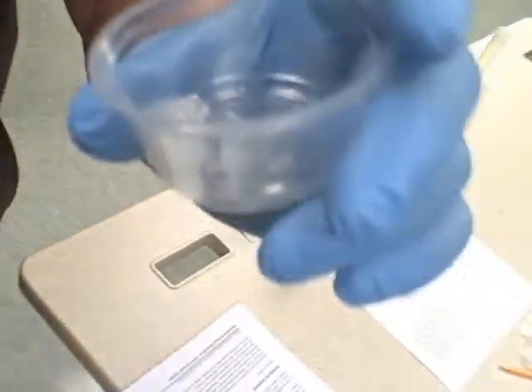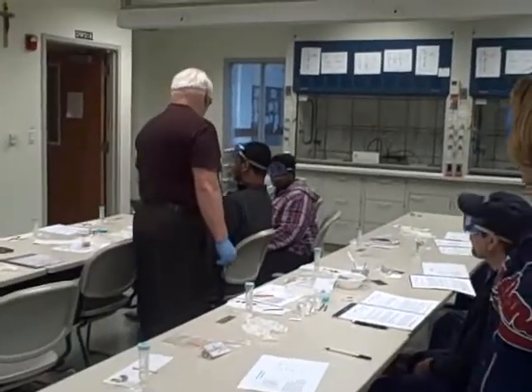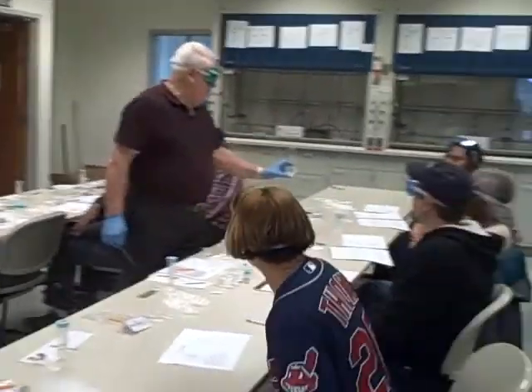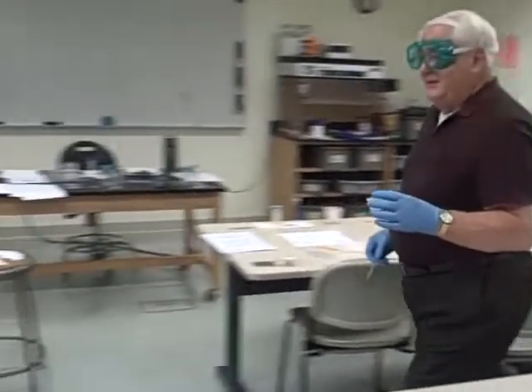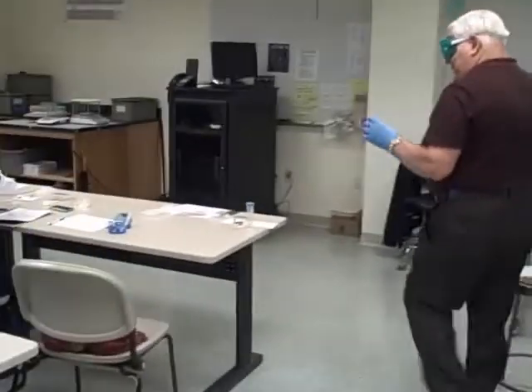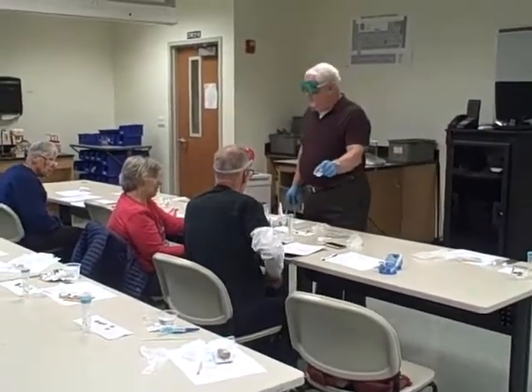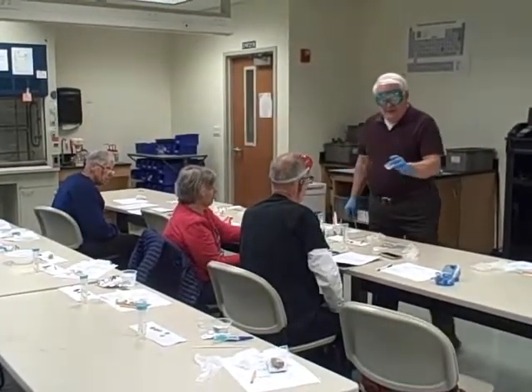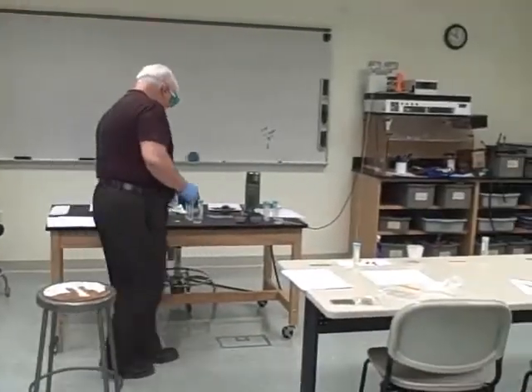Okay, let me take this around and show it to all of the students that are here. Look what's happening with calcium with just some water. Now it's kind of going, and it's exothermic as mad, as you know. Didn't melt the cup yet? Well, we got polypropylene cups so that it wouldn't do that. So you can see what happens with calcium in water.